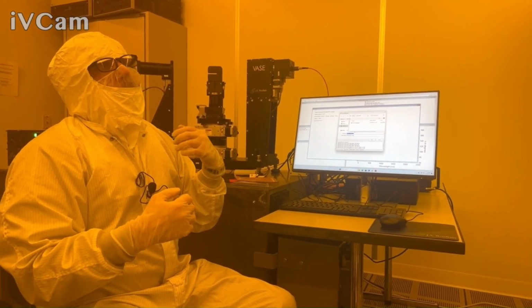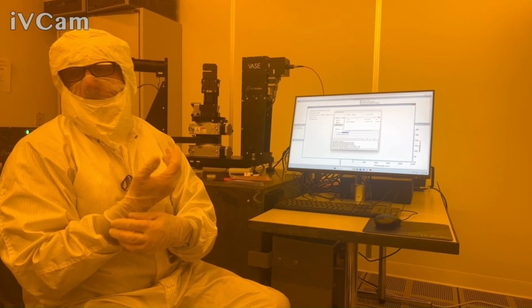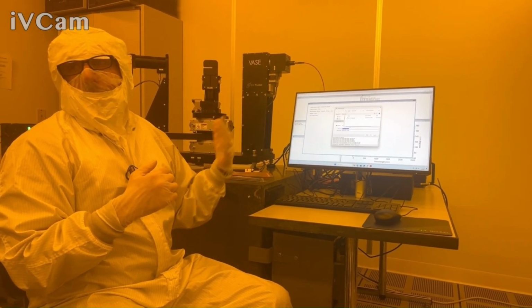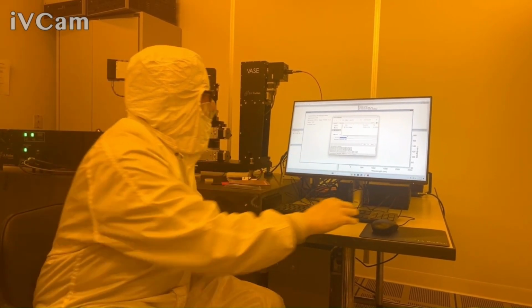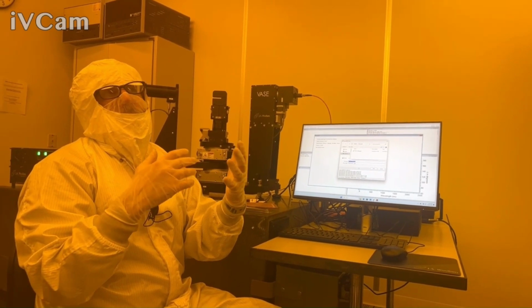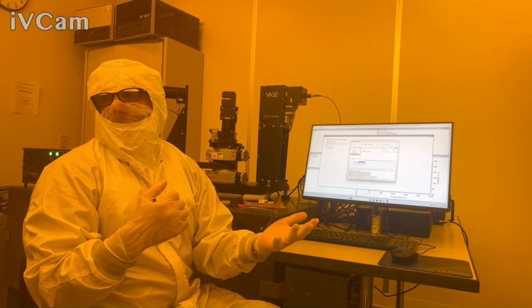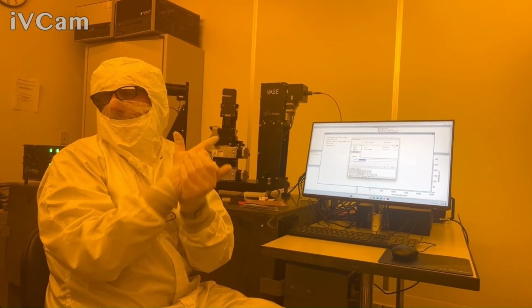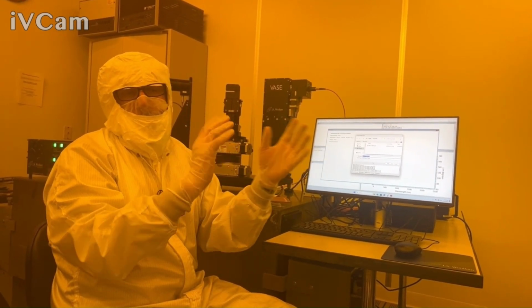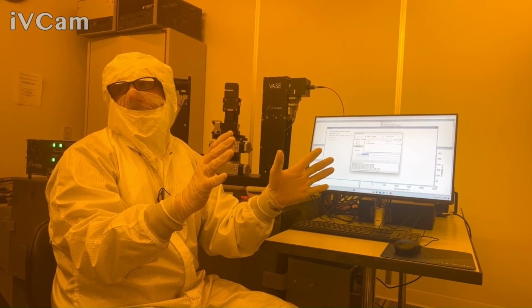If you ever have a concern that something is off with the instrument, this is a check. So you can check this wafer. That's why it says whatever the manual calls, system checks or something. Basically, if you have a concern on the accuracy of the tool, I can check air and I can check this wafer. Those are the kind of things we can gauge against to see if the tool looks fine or something's weird.